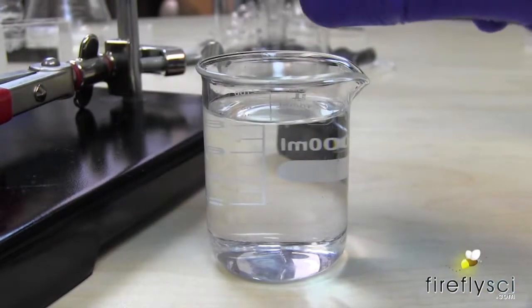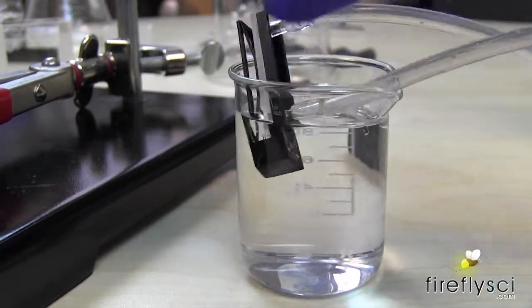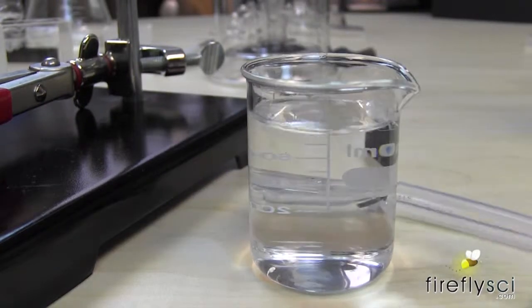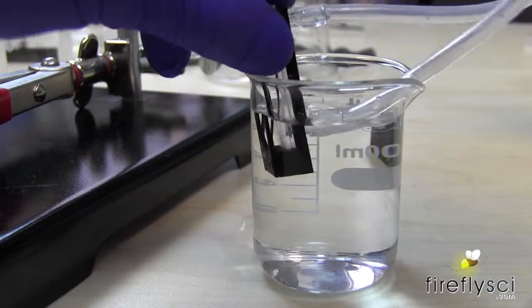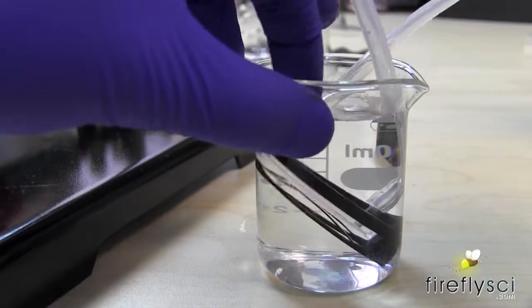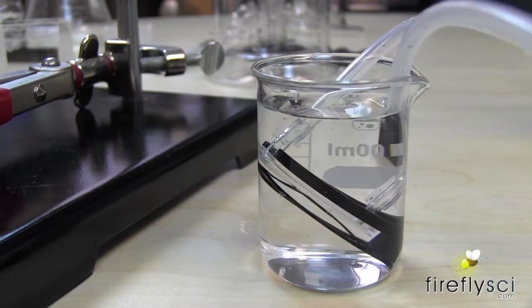Another test that I am going to run is I am going to put it in this water here and if we have any leaks you should be able to see air bubbles. Whoops. If I can manage to get it in there that would be great. All right. Then we'll do. So I am going to put it up to a high pressure pump and see what happens now.